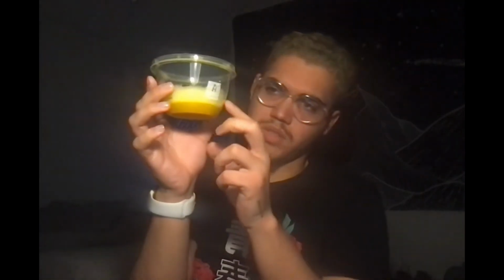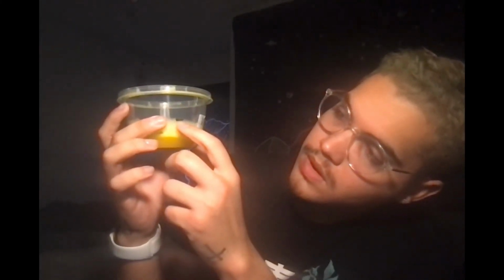My results, I have pictures that I'll attach, and I'll make a whole movie. It kind of shows all the solution versus the foam, but it started off, where did it start off? It started off here. No, I'm lying. I'm so sorry. It started off here. And then it went down to here. So pretty much the same. And then it ended up here after 6 minutes.